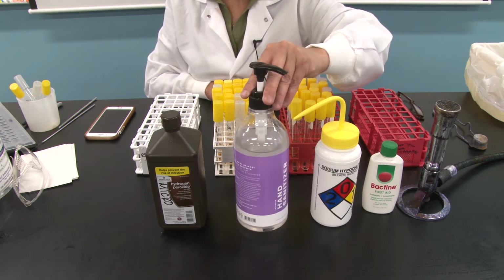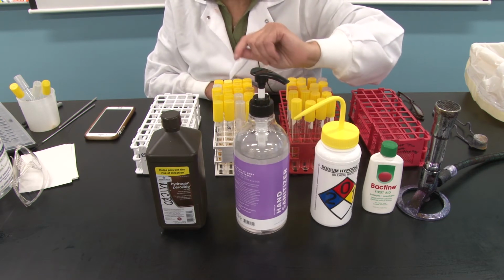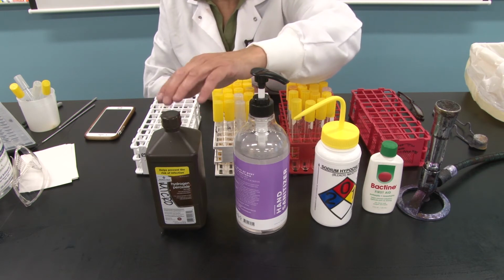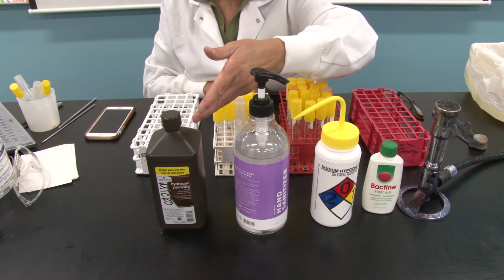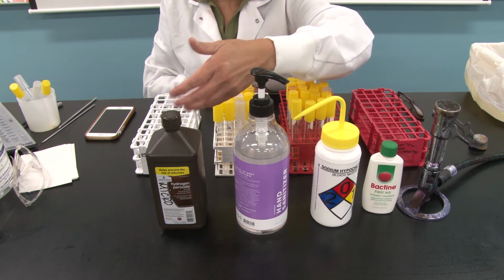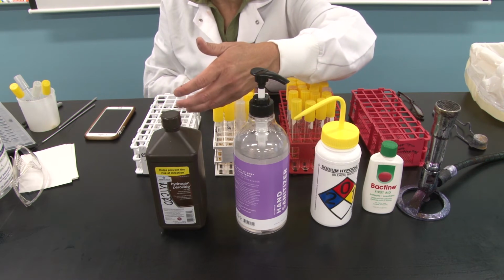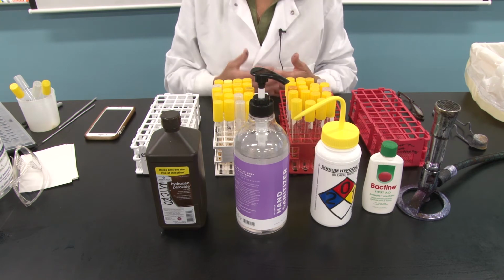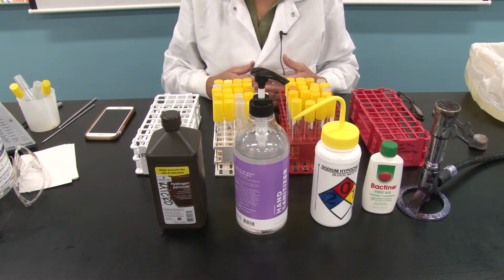Hand sanitizer, this is an antiseptic, although we know alcohol in general can be used as both an antiseptic and a disinfectant. And we've got hydrogen peroxide, which also can be either an antiseptic if you pour it in a wound, or if you're using it to get blood out of a fabric or whatever, it's being used as a disinfectant. Okay, so those are the 4 disinfection chemical agents we are going to use today.